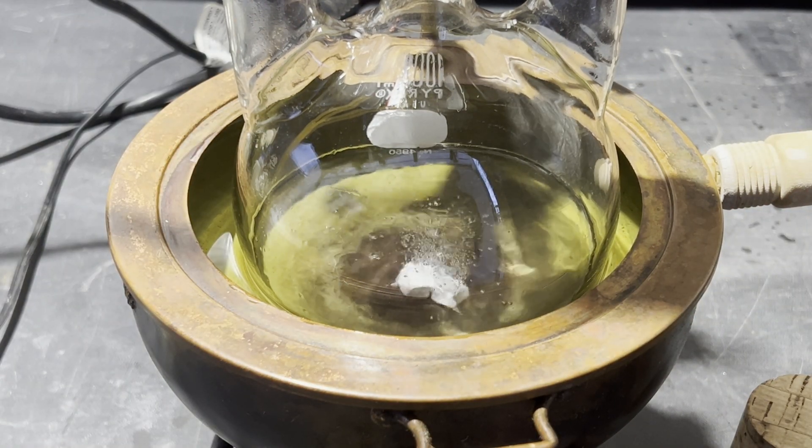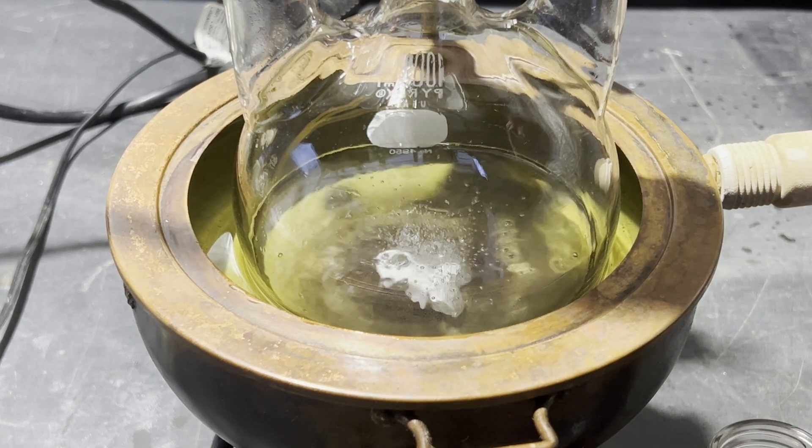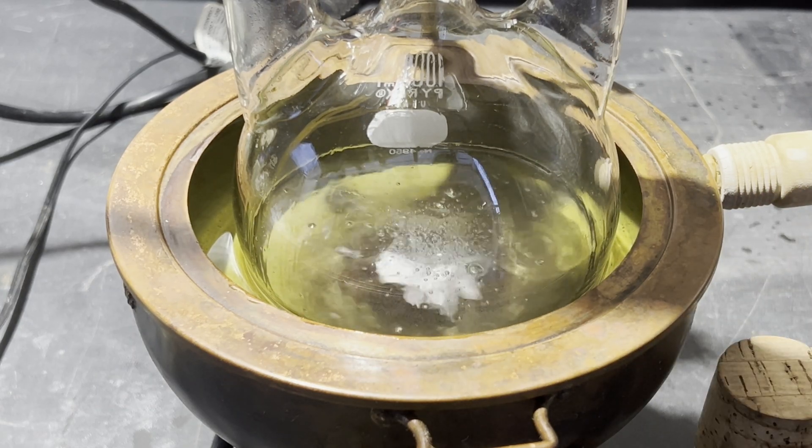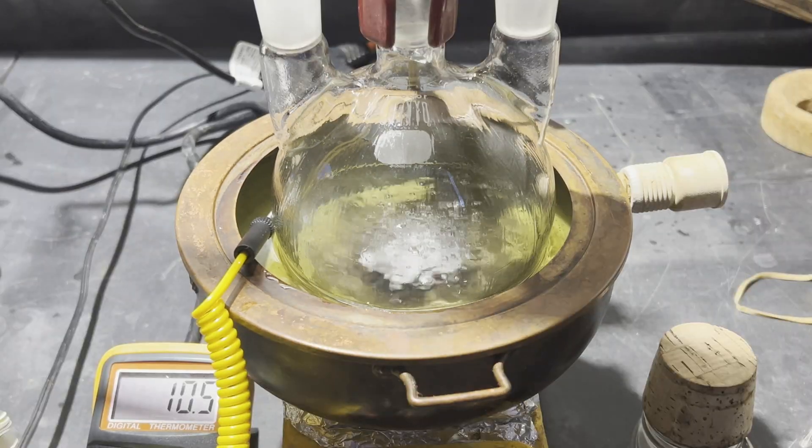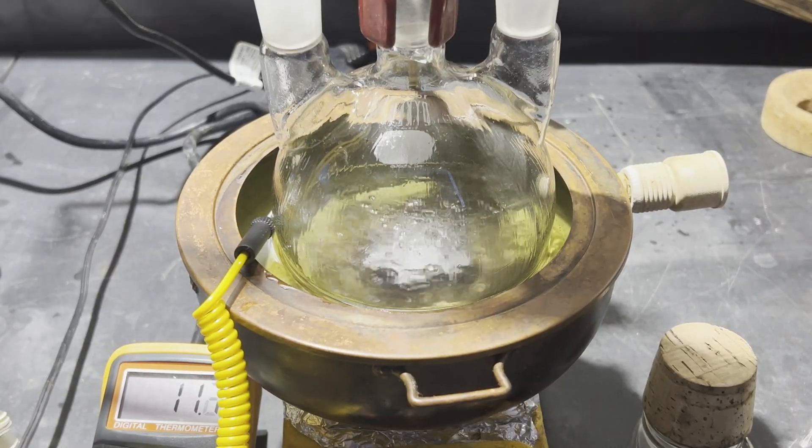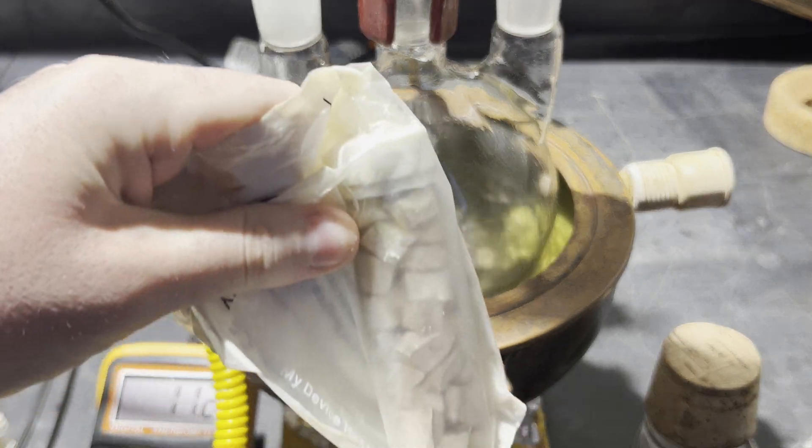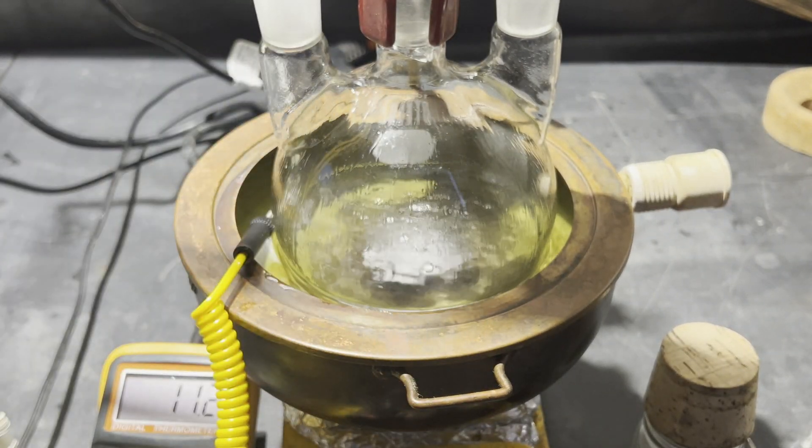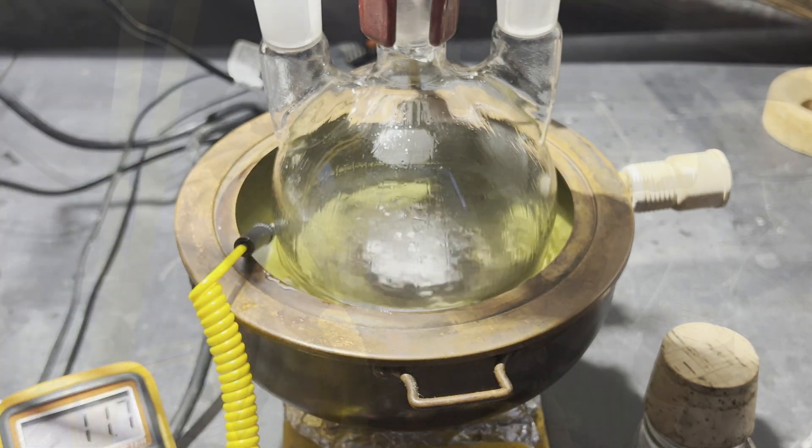Kind of like with nitric acid, but for a different reason. Sodium is easier to handle with bare hands, because if it gets on your glove and you don't know about it, and it starts spontaneously reacting and heating up, it could start a sodium fire on your glove and melt to your hand, which is not great. I definitely could have added it faster, because it just said to add it as fast as possible without it getting out of hand, but I was playing it safe.